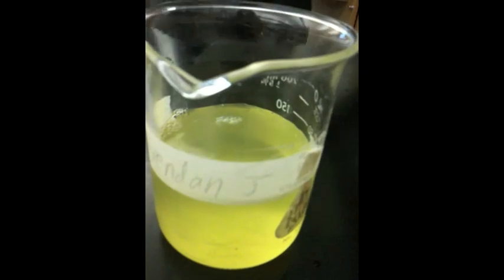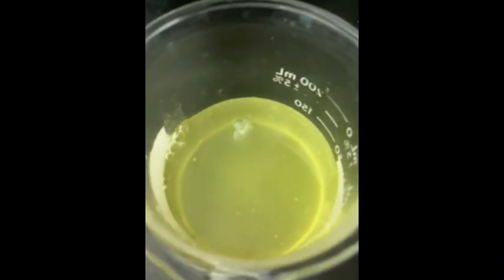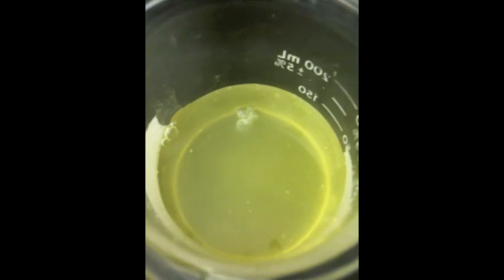In an aqueous system of strontium chromate, we will be providing strontium hydroxide to apply stress. This is also known as the common ion effect.